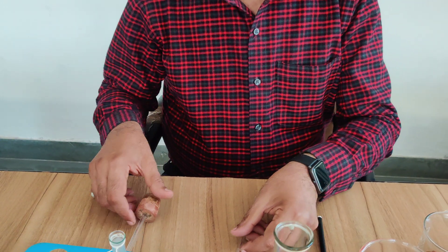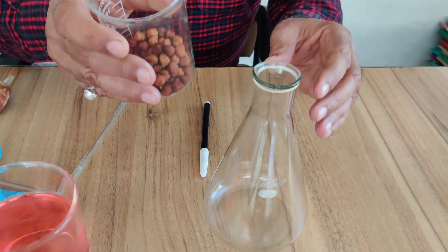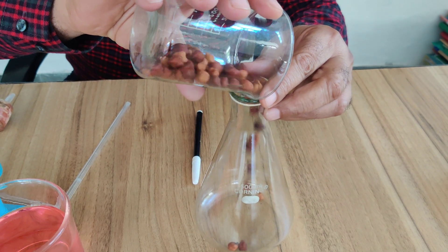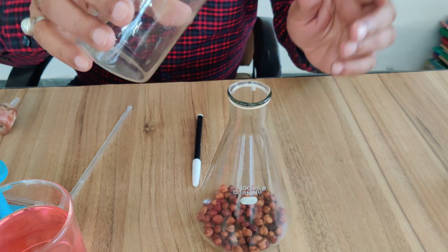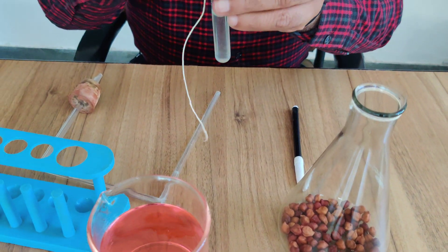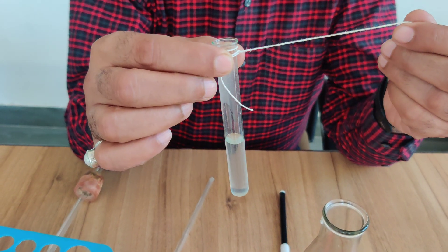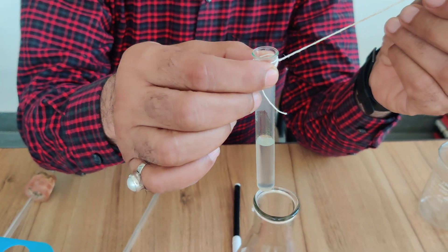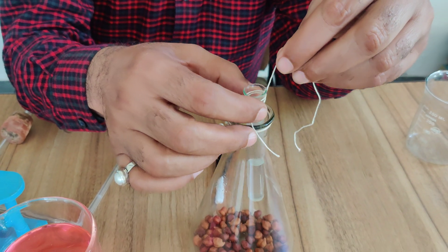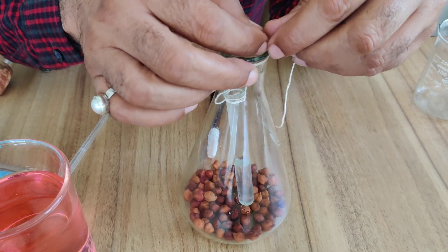So let us start the experiment. First, I am taking these germinating seeds — soaked germinating seeds — and placing them in the conical flask. These all are living seeds. Now, this test tube contains KOH solution. We have to keep this tube inside the conical flask. Hang this tube with the help of a thread in the conical flask.